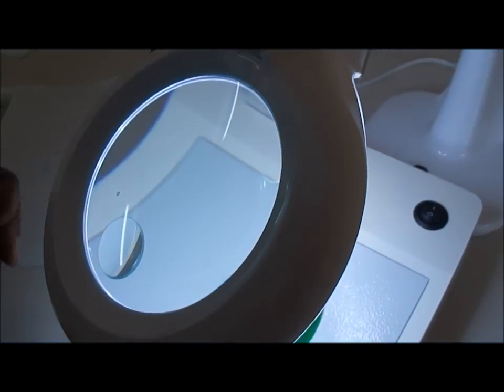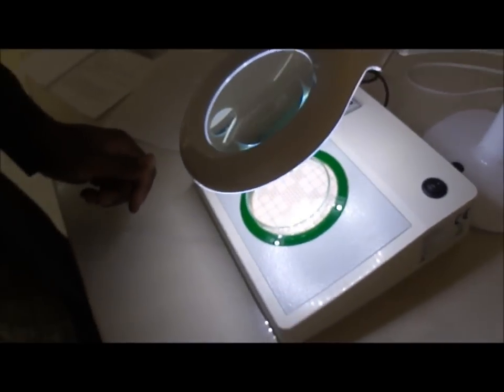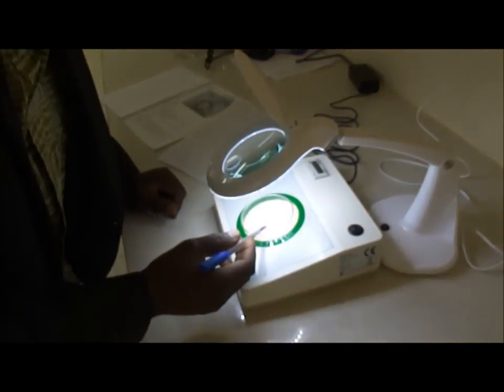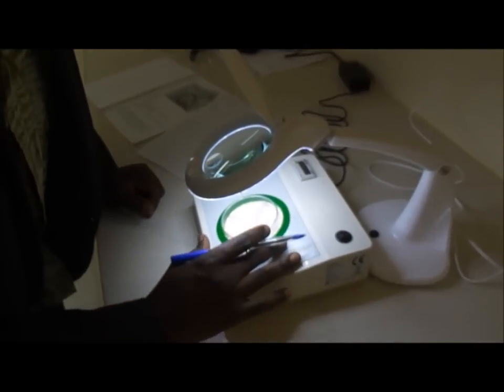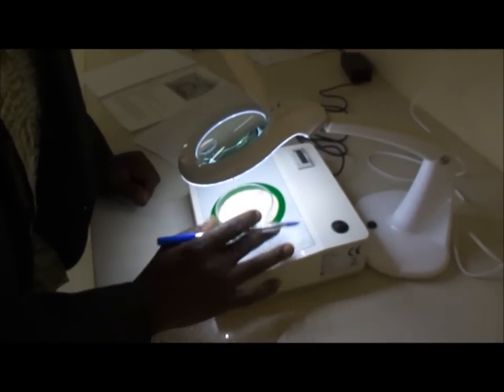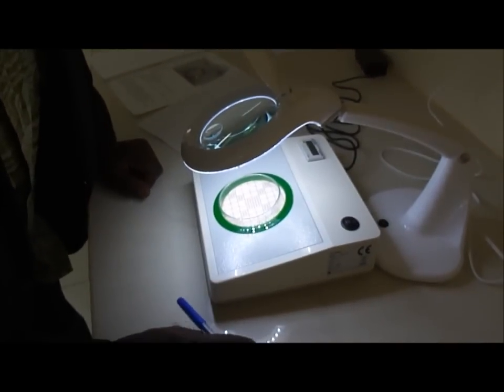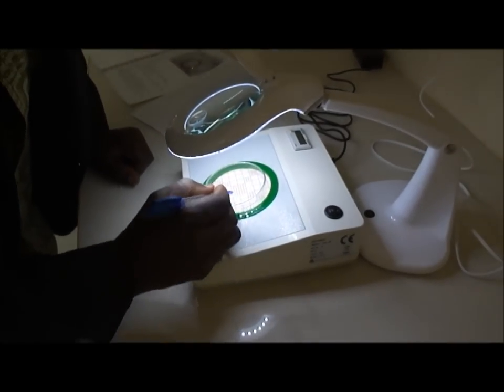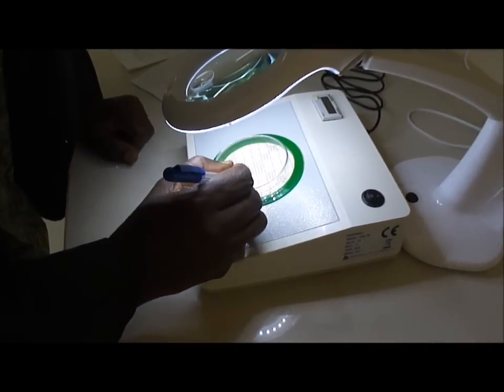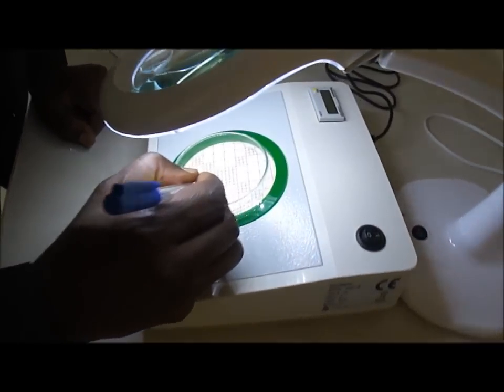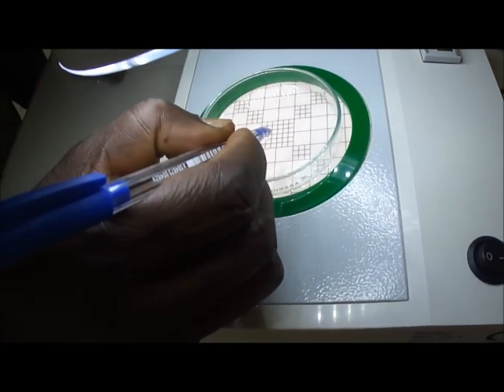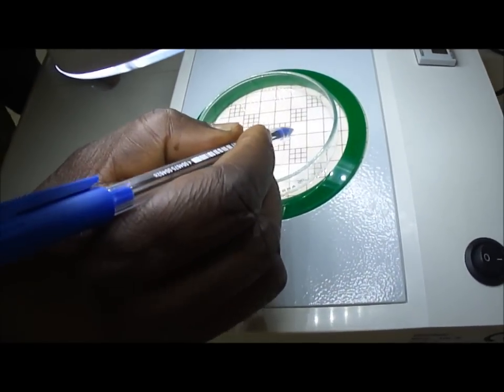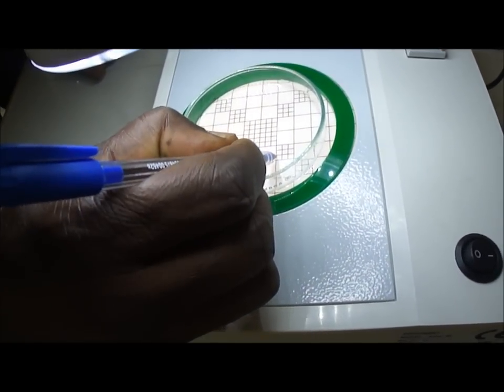And then you look at the inside, the plate, through the magnifying glass, and then you can count now, by just pressing at the bottom, at the top of your agar, you can count the colonies.